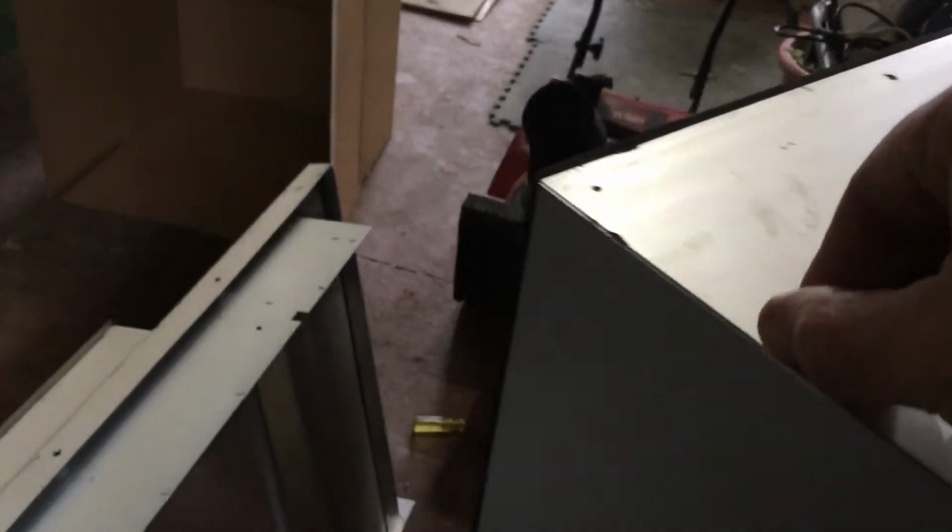It's got a lip here, and it looks like it might be one piece of metal that's folded 4 times, because I don't see any creases or seams along the corners. And on the inside, there's a spline or a ridge right here, and it doesn't come out. It looks like some sealant here that's hard as concrete. And I don't know why that's there, because I don't see any evidence of a seam. There's got to be a seam on one side, I would think.